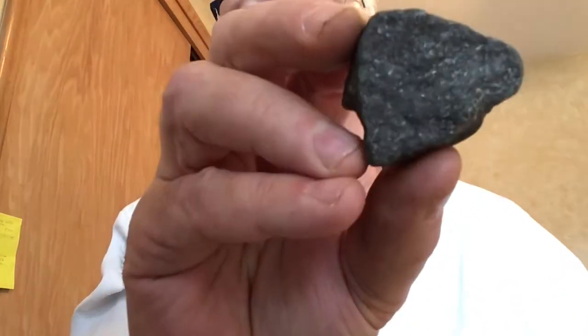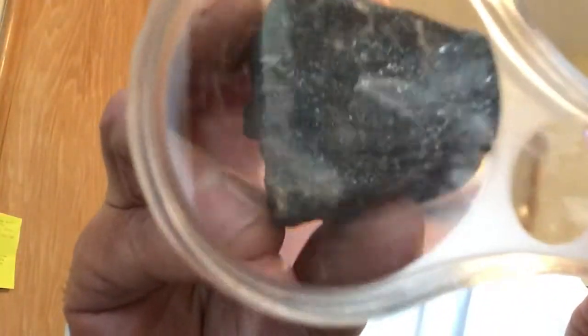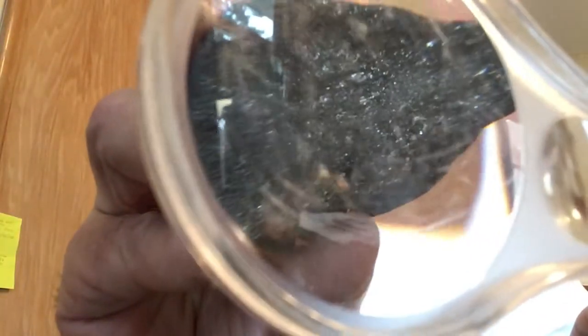This one's a little tricky. If you look real closely, you see how shiny metal it looks like. And if you were to look through it through a hand lens, you'd see that as well. That you definitely are getting some shininess. That is metallic luster. Its color is black for the most part. And let's check its streak. Oh yeah, big black streak right there, that one. So the streak is black.